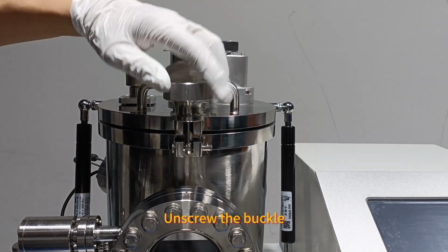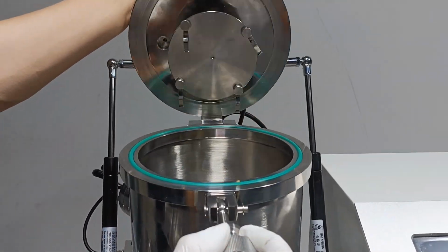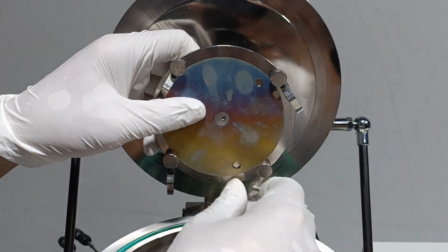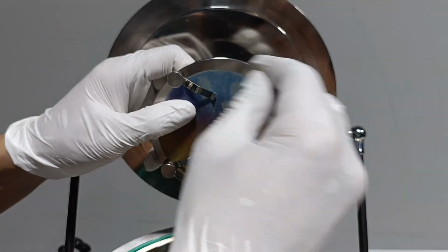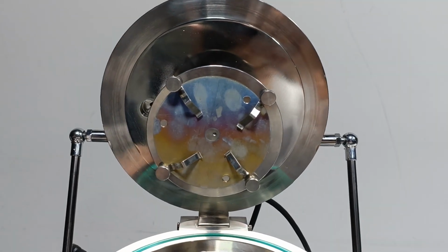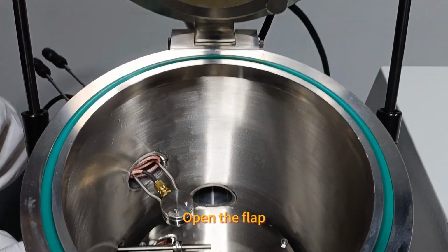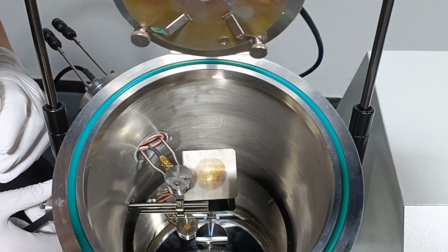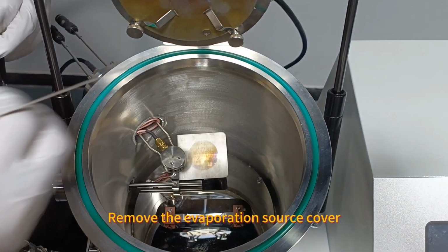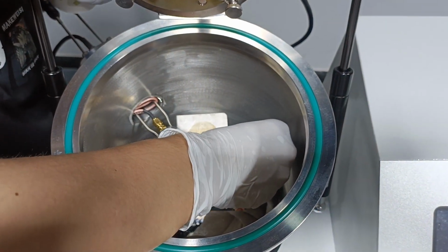Unscrew the buckle. Open the cavity. Installing the sample. Open the flap. Remove the evaporation source cover. Place the evaporation source material.